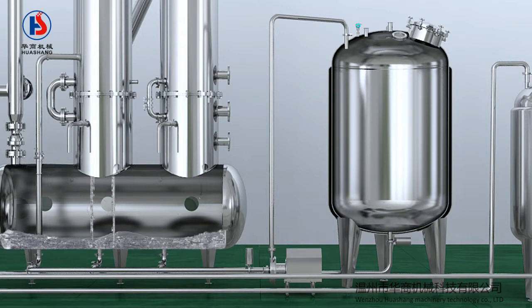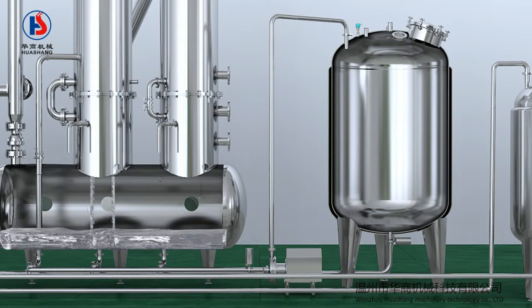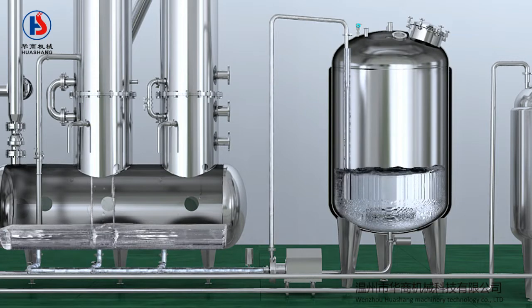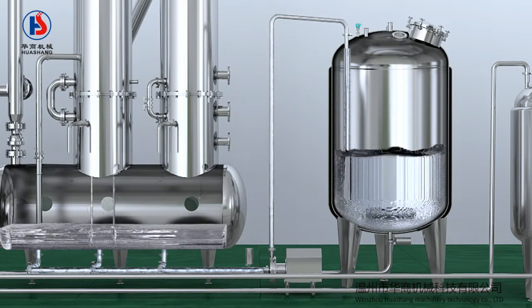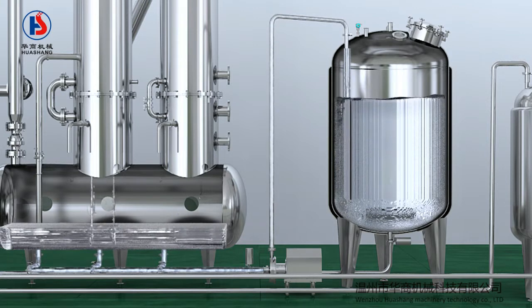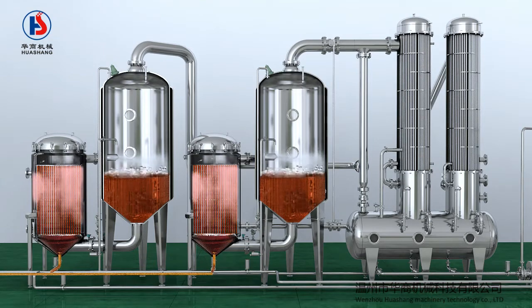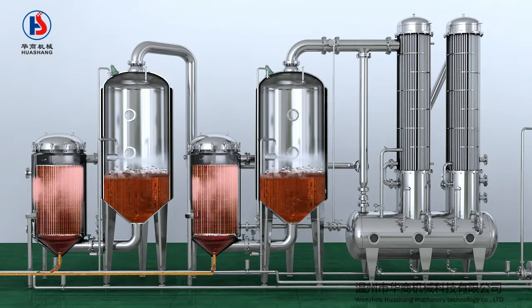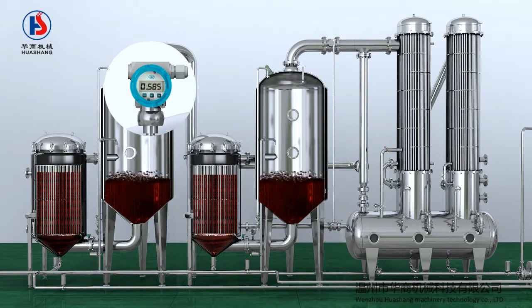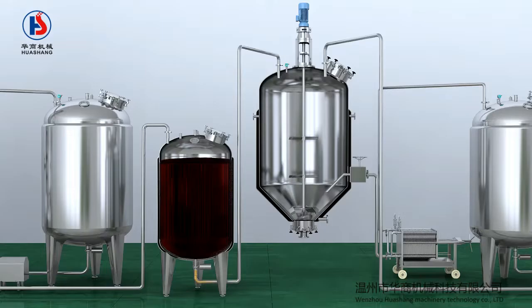This storage tank has an automatic drainage function. When the liquid level exceeds the preset level, the pump automatically opens and transfers the liquid from the storage tank to the condensed storage tank. This condensed water with waste heat is clear and clean, and can be recycled as solvent for the extraction tank. The liquid in the concentrator will be continuously heated. If the concentration reaches the preset value, the system will stop heating automatically. Break the vacuum and open the drainage system, and the liquid will be transferred from the concentrator to the storage tank. According to the technical requirements, the concentrated liquid is conveyed to the alcohol sedimentation tank.